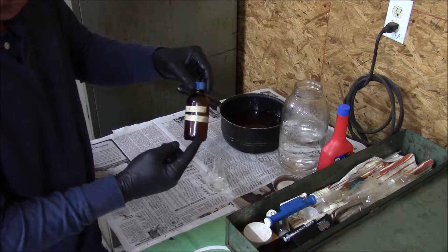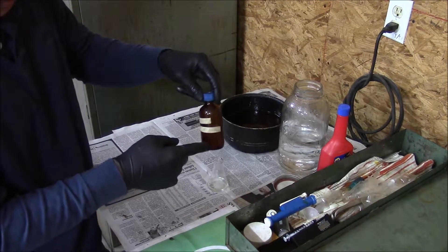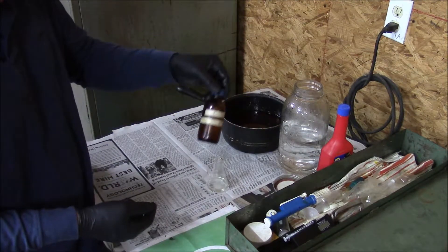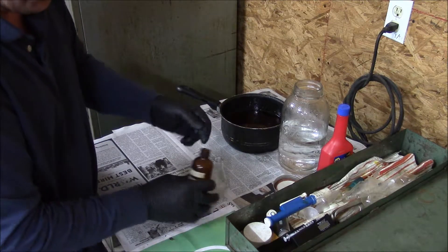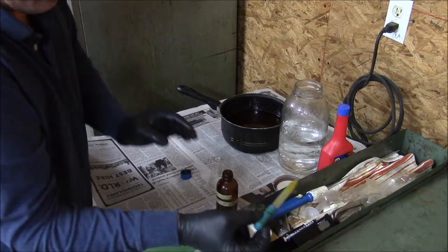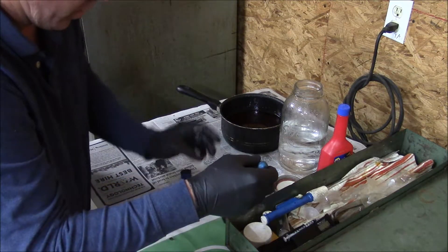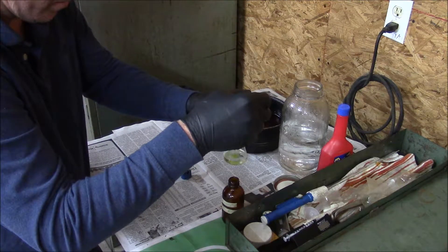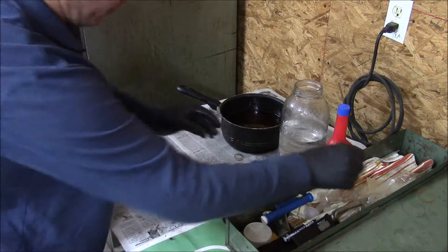So realistically, all you do is put about a teaspoon of turmeric in a container about this size, fill it up with isopropyl alcohol, and then you've got enough indicator solution for hundreds or thousands of titrations. I've got a dedicated little eyedropper for this. I'm going to add just a few drops — I usually add five drops in here.